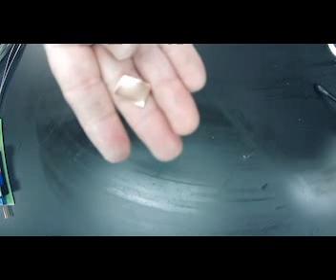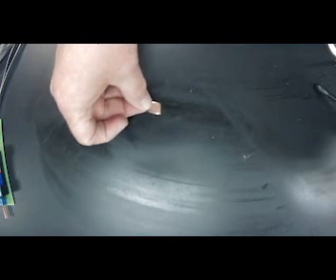It should be malleable. We shouldn't see it break apart when I tap it. It should be lustrous. And here's our copper. It is very shiny, as you can see. I don't know how to explain it because we always say it's copper color. Kind of like a bright, yellowish orange. Okay. All right, and it's already in a flat sheet.